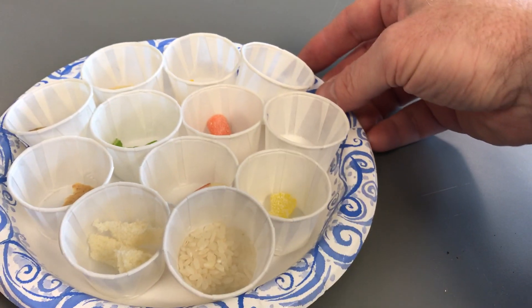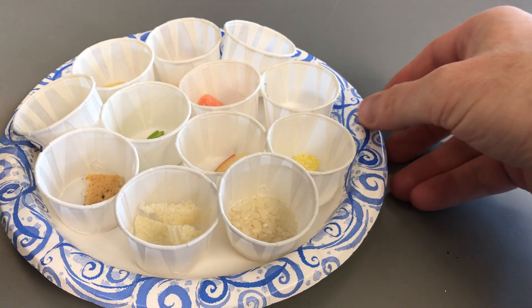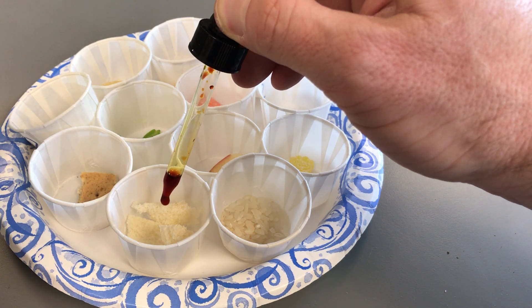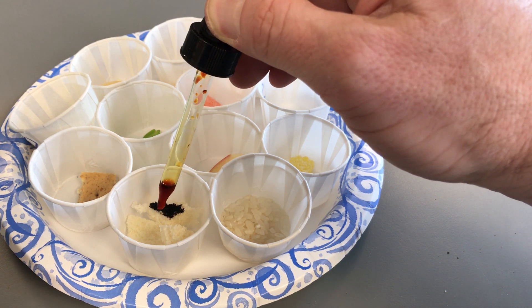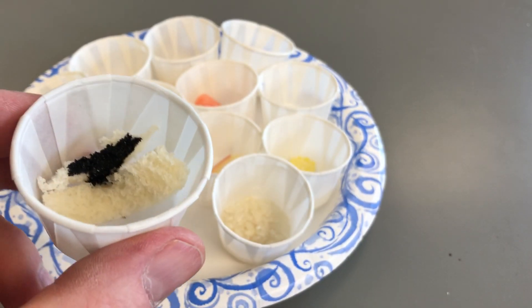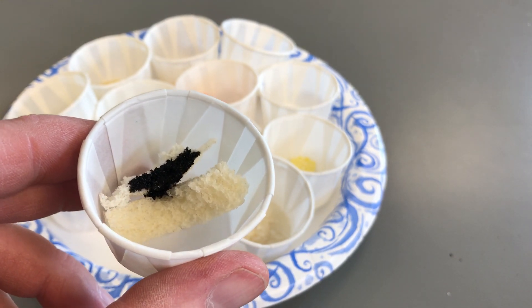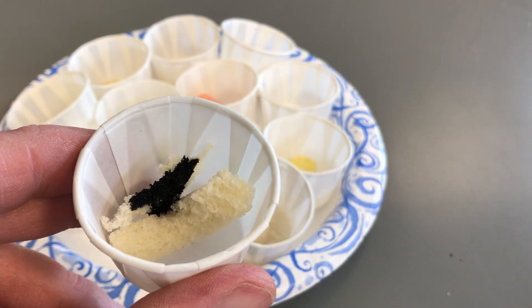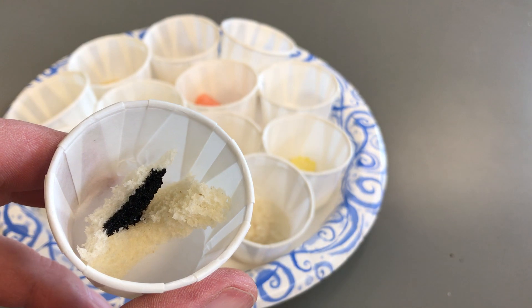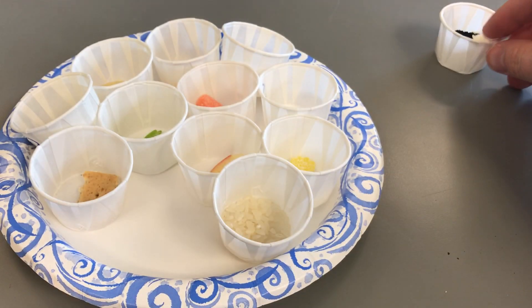The first sample is bread. We're looking for any instant color change. The bread instantly turns very dark — just like the paper towel did. So again, a change to black is a positive result. In the third column you'd write whether it turned black or stayed amber, and in the last column that's your yes or no for starch present. Bread is a positive.